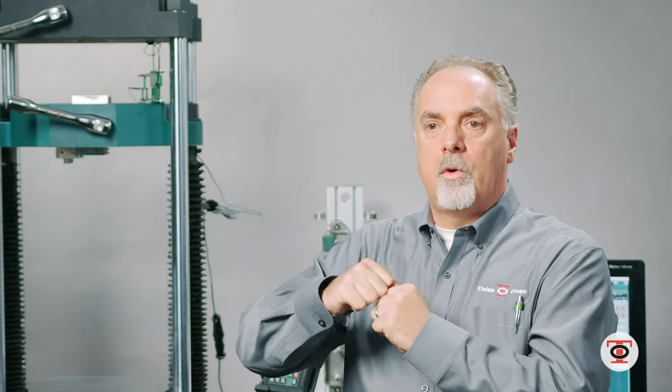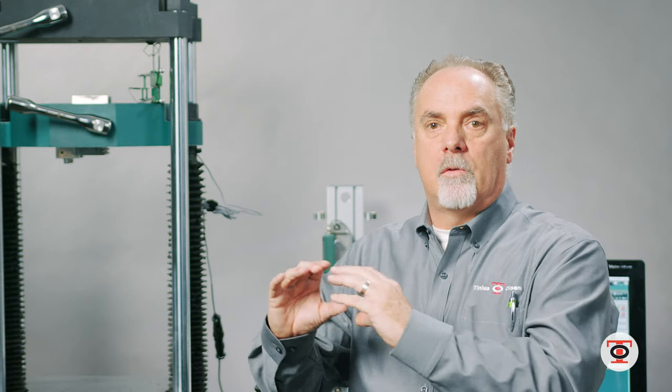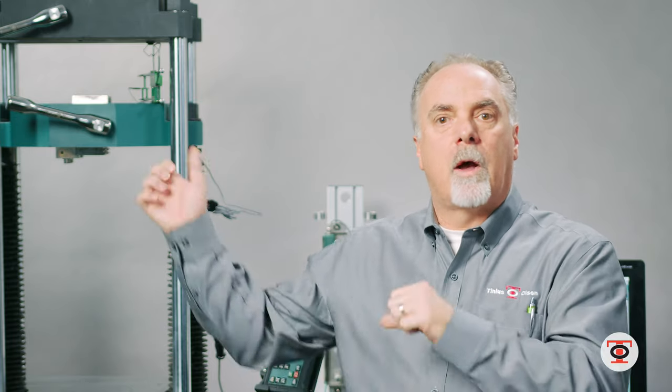The reason I do this is because when you have a violent break, that pinion shaft which is connected to the grips, which has a handle on it, that weight will restrict the pinion shaft from spinning and cause possibly the teeth to wear prematurely. So I remove the handles so the pinion shaft is free to spin with no weight on it.